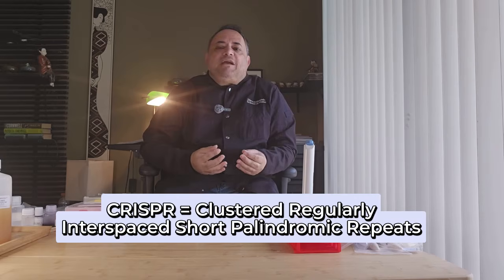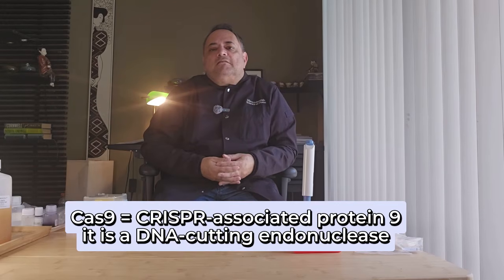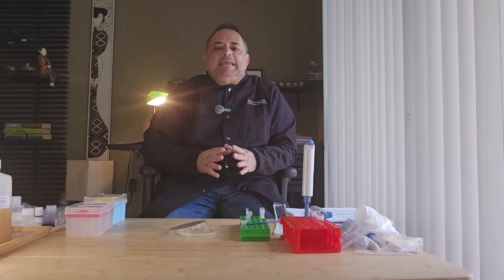CRISPR stands for clustered, regularly interspaced, short palindromic repeats. Cas9 stands for CRISPR-associated protein 9. It's a DNA cutting endonuclease. In this lab today, we will use E. coli.